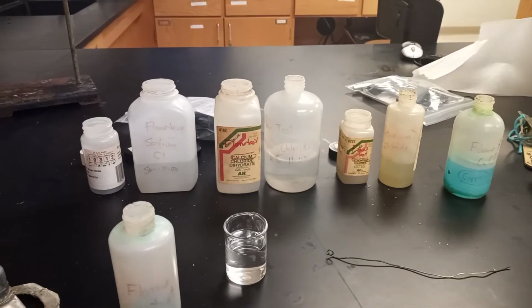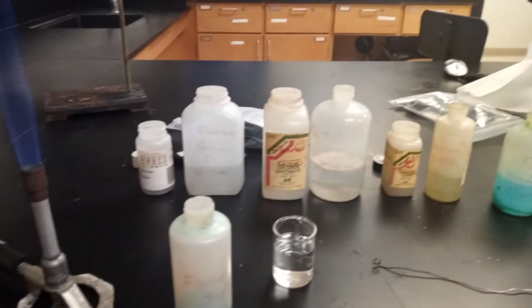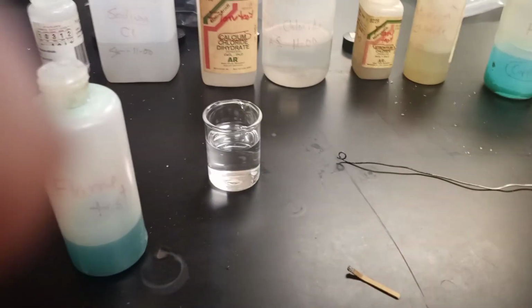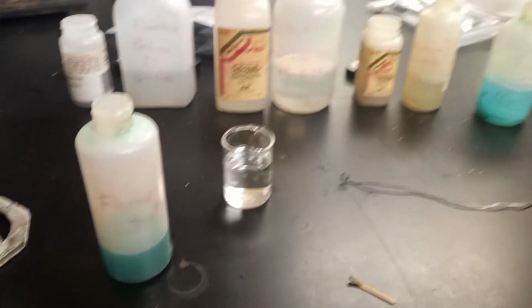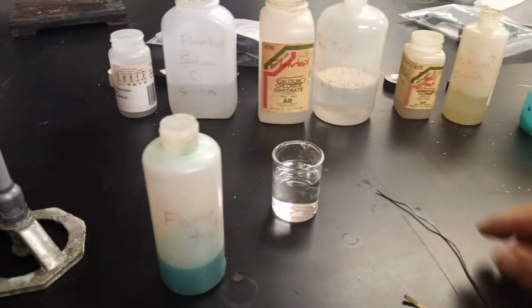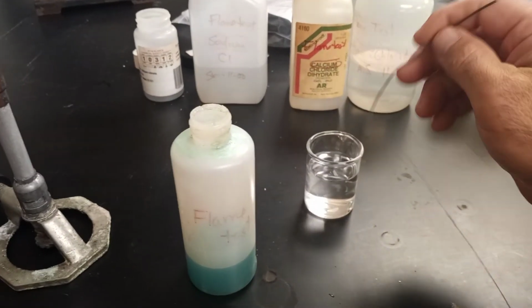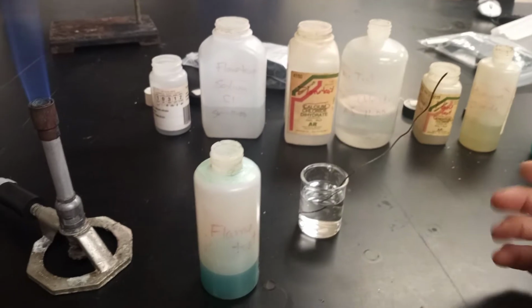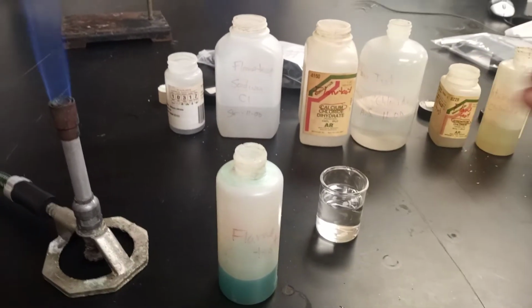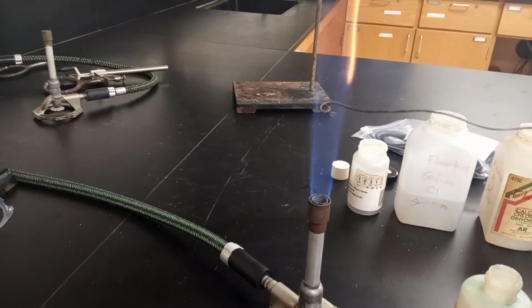Okay, so I'm going to start by burning up the first 3 chemicals. Now, the chemical that we have in the jar here is simply going to be acid. And this acid just cleans off this guy. So in class, all we're doing is going around and burning them, taking a look. Okay, so I take my little acid, burn it off. All right, let it heat off a little bit.